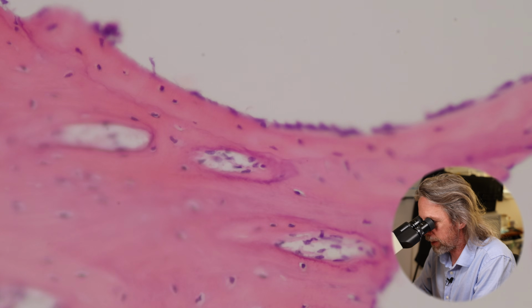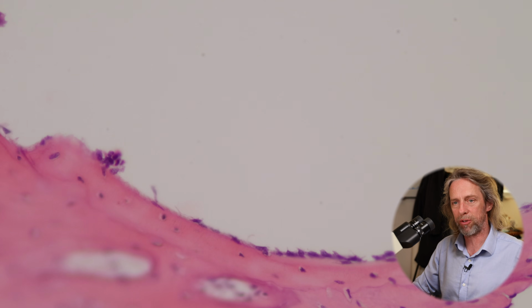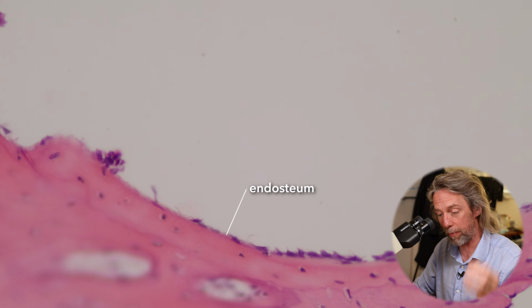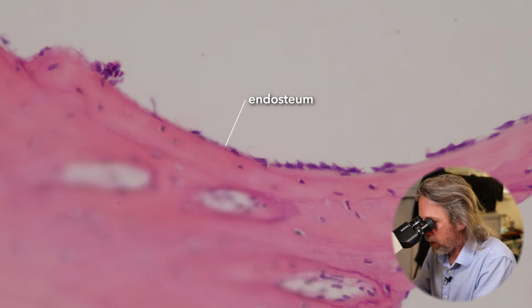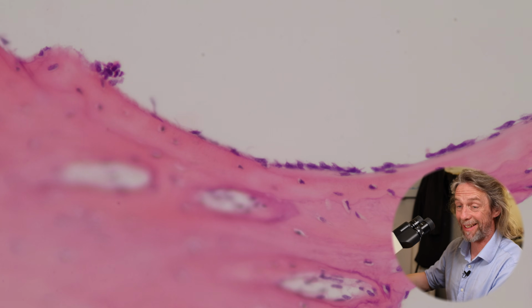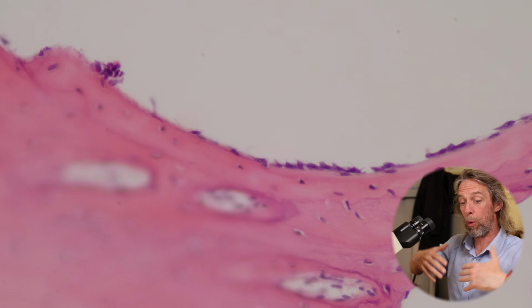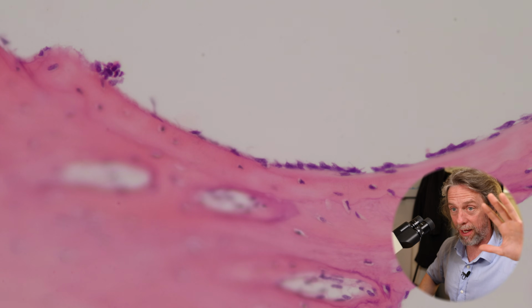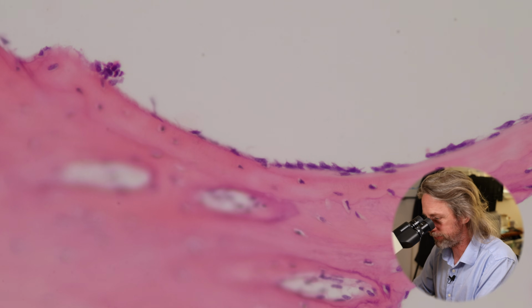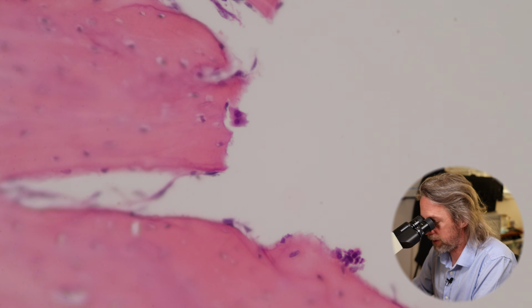Okay, so if the periosteum was the outside surface of the bone, the inside surfaces of the bone here are covered by endosteum, and it's a little bit different. Here we also find osteoprogenitor cells. Now those osteoprogenitor cells will become osteoblasts, which are going to lay down new bone. So we'll see osteoprogenitors and we'll see osteoblasts in the endosteum. Keep it up. Oh, there's a little dude there.